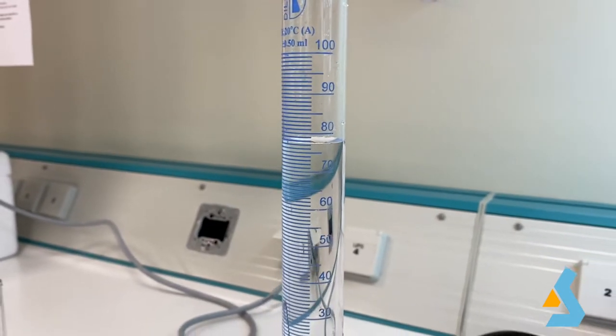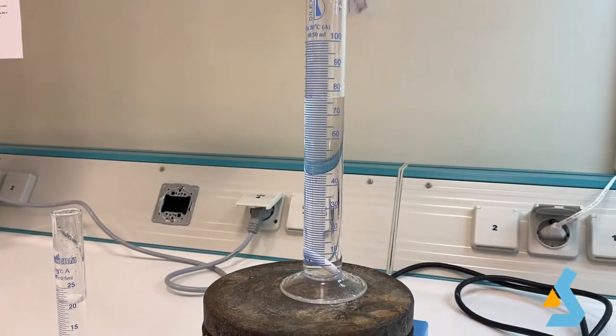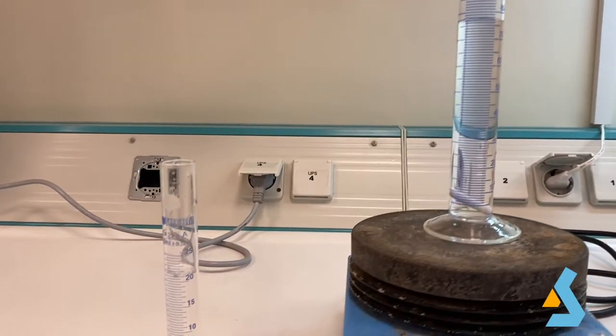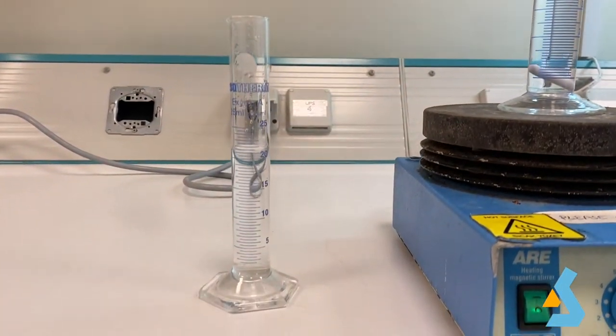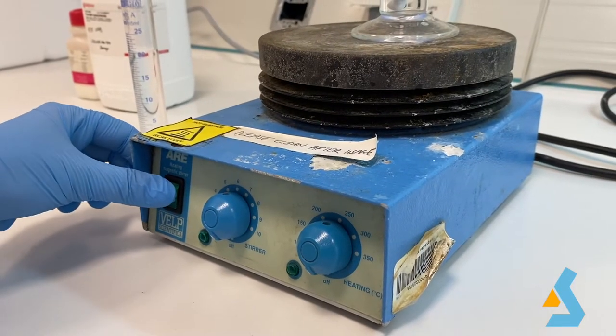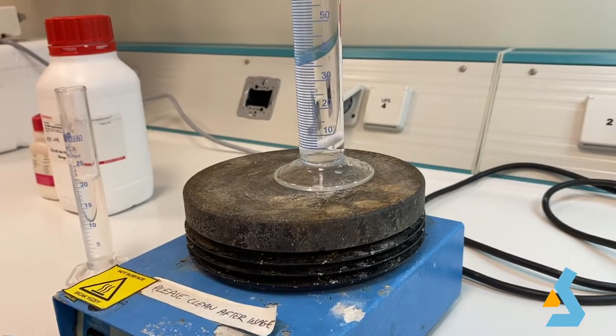Prior to addition of our chemicals, we filled a graduated cylinder with distilled water. It is important to indicate that we didn't fully fill the whole 100 milliliters with water, but left some space. If 100 milliliters was filled in first, then addition of chemicals would change the overall volume, thus the final concentrations. We place the magnetic stirrer inside of the cylinder to make sure the buffer is well-mixed throughout the preparation.